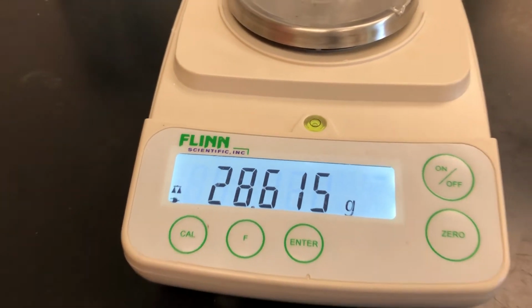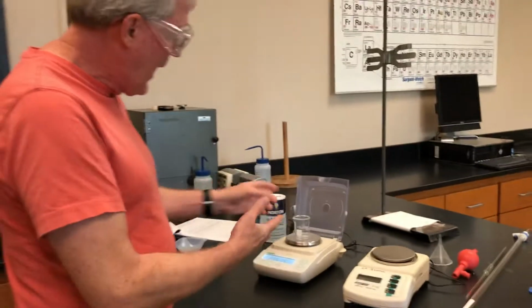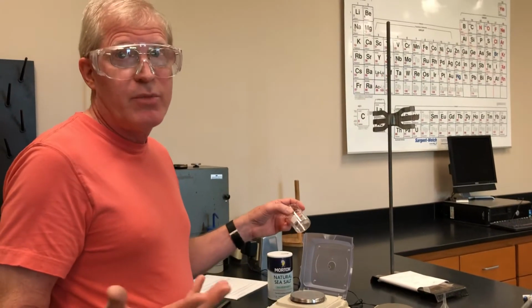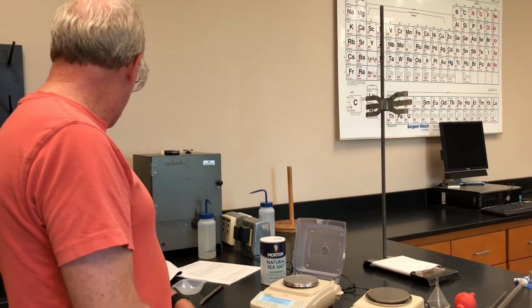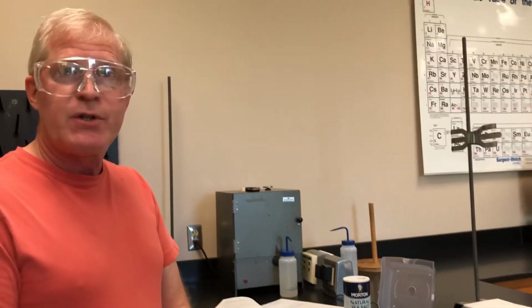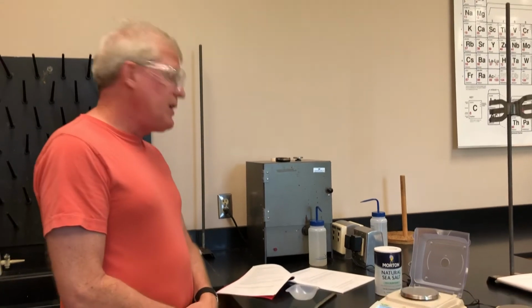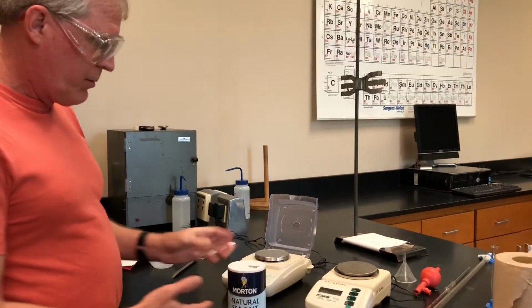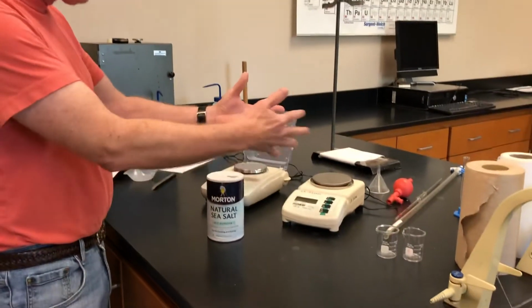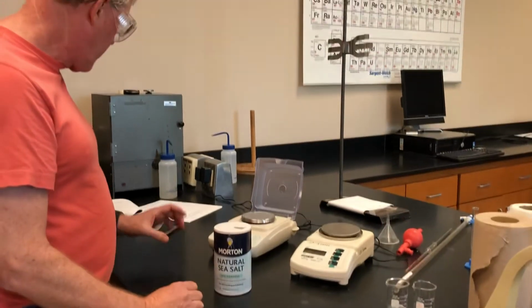And what we're trying to show you is that different balances will give you different values, and different beakers are going to give you different values for your mass. So now I'm going to pretty much just finish this up by weighing out some salt. The procedure says that I'm supposed to weigh out 0.5 grams of salt. I've got the salt right here, nothing really special. This is just all about how you're supposed to use the electronic balance and doing it correctly.